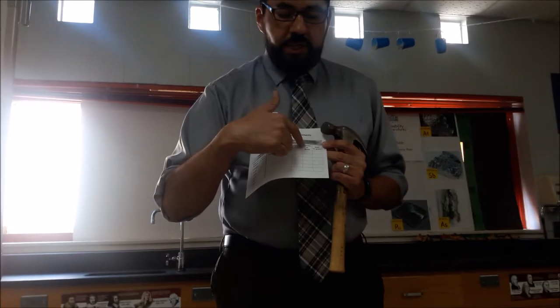Hey guys, it's me again. We're at the point in the physical properties of common elements activity where the only thing that you don't know is whether each of the substances is malleable or brittle. We can't have you testing that, otherwise you guys would destroy all of our materials. So that's why I'm only going to do one set of the materials, that way we still have plenty for you guys to test year after year.